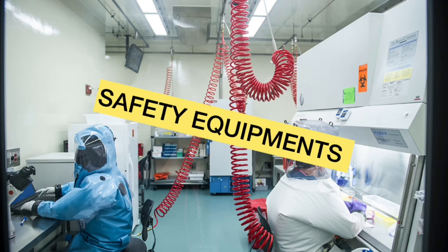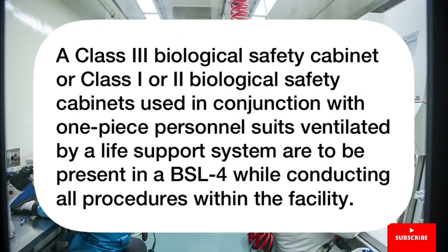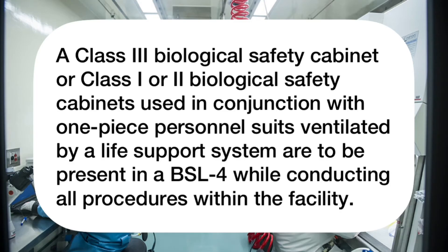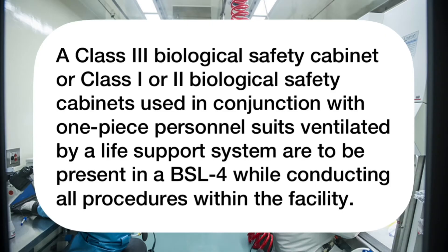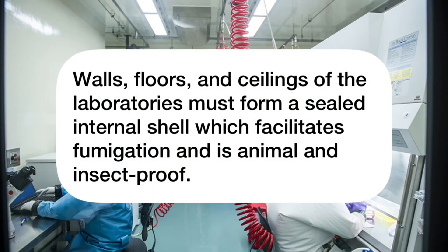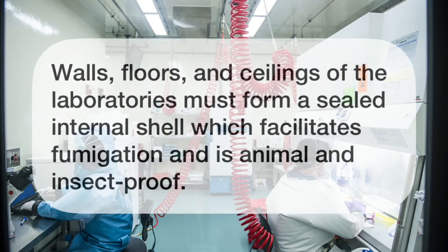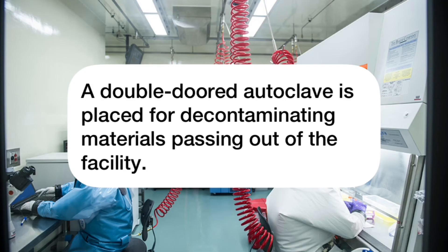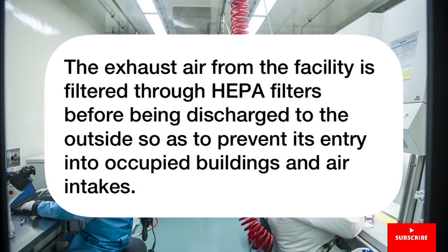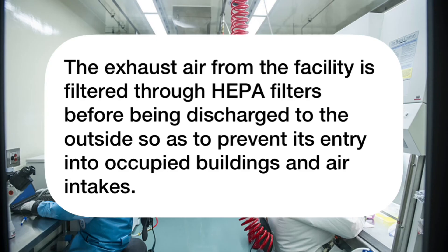Safety Equipment Required in a Biosafety Level 4 Laboratory: A Class III Biological Safety Cabinet, or Class I or II Biological Safety Cabinet used in conjunction with a one-piece personal suit ventilated by a life support system, must be present for all procedures within the facility. The walls, floors, and ceilings of the laboratories must form a sealed internal shell which facilitates fumigation and is animal- and insect-proof. A double-doored autoclave is placed for decontaminating materials passing out of the facility. The exhaust air from the facility is filtered through HEPA filters before being discharged to the outside to prevent its entry into occupied buildings and air intakes.